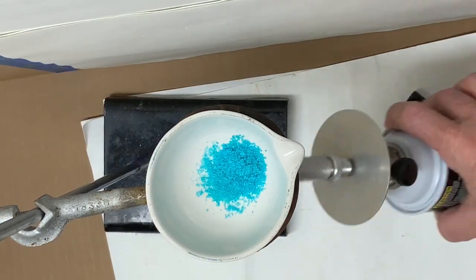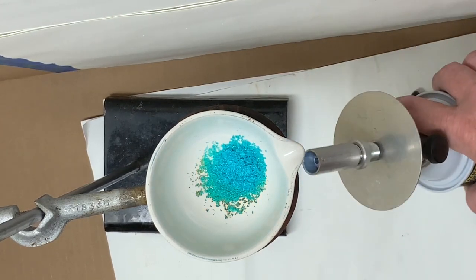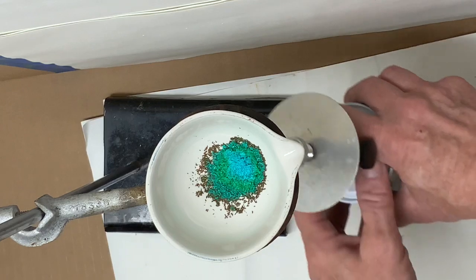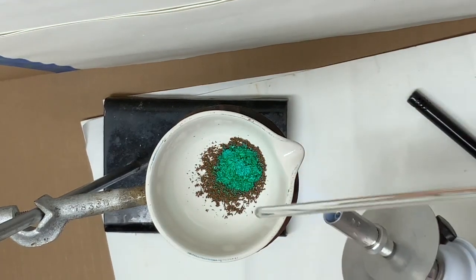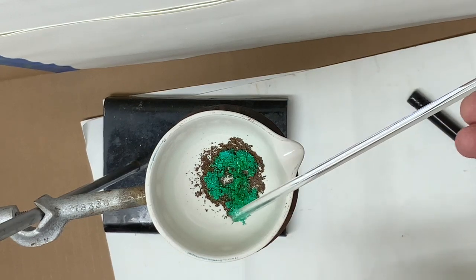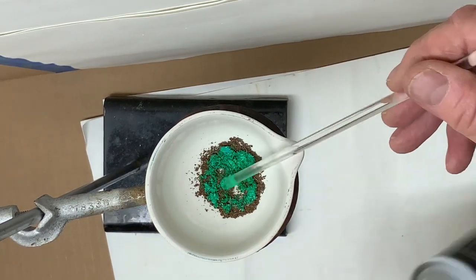Watch the changes of the copper chloride hydrate while it is heated. It is really tempting to want to poke at the hydrate, so you will see I will be using a glass stirring rod. That, of course, provides an opportunity, sadly, for material sticking to the stirring rod, which could introduce sources of error. You will see me spending some time trying to make sure that every last bit of the hydrate is removed.